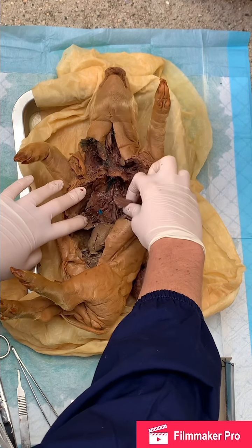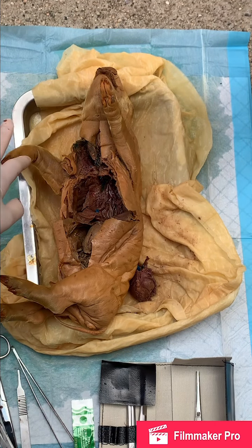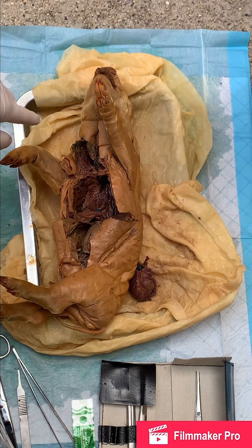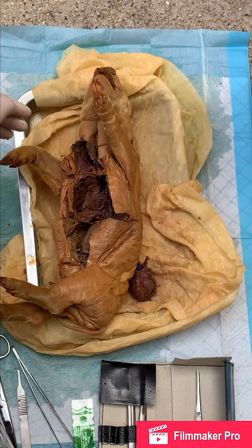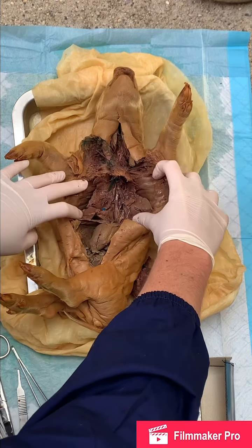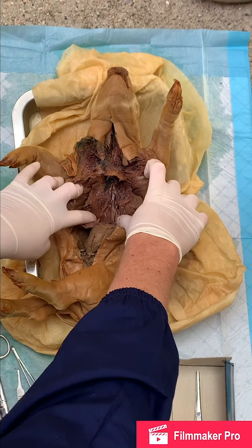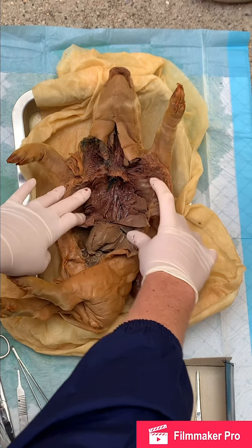And one thing I learned when I was researching about the lungs in a fetus: if a baby were to die and they tried to research if the baby was dead in the womb or if the baby died after birth, they would look at the lungs to see if they were inflated and if the alveoli had fully developed to participate in oxygen exchange. So this is the basics of the respiratory system of the pig, and I will answer my post-lab questions after this.